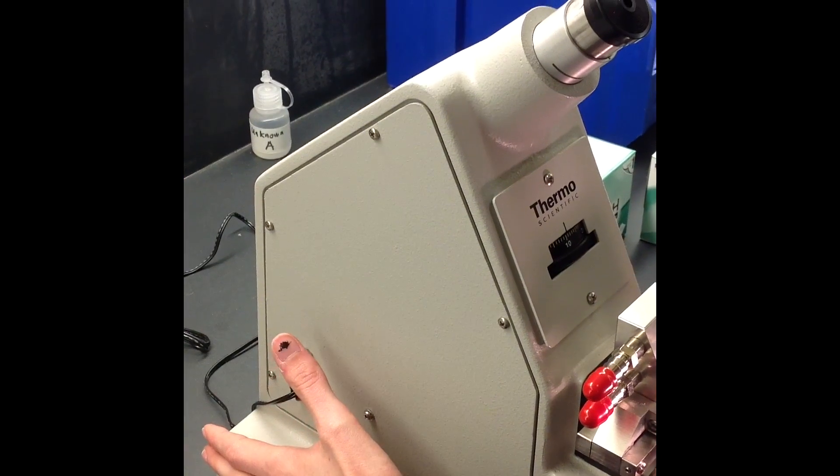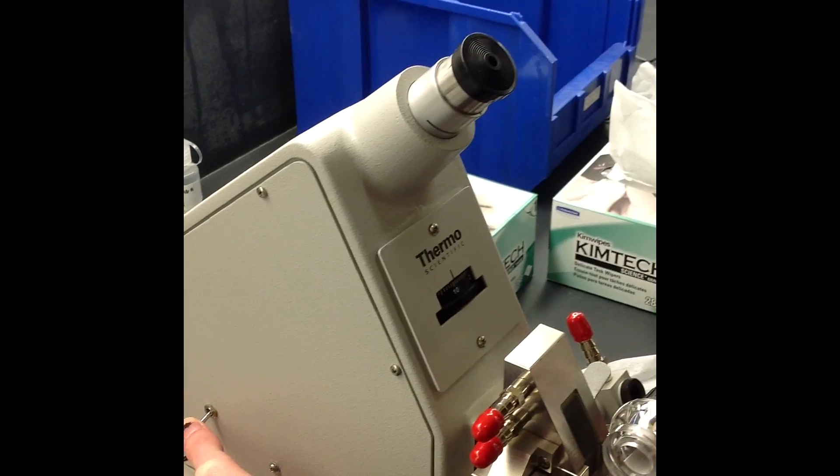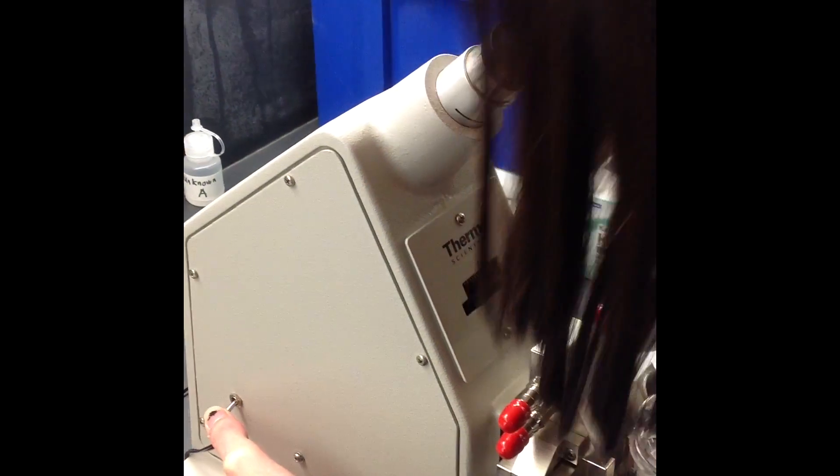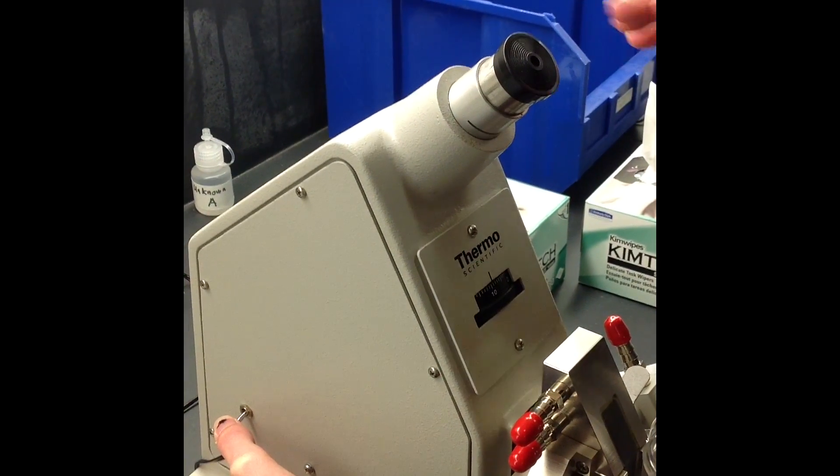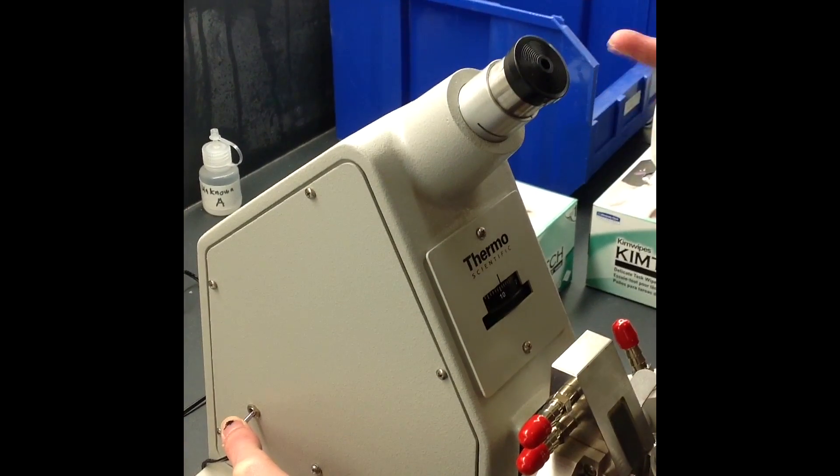Now I'm ready to take my reading. I flip this down, the light will go off, and then you'll see the reading scale up on top where you can take your numerical reading.